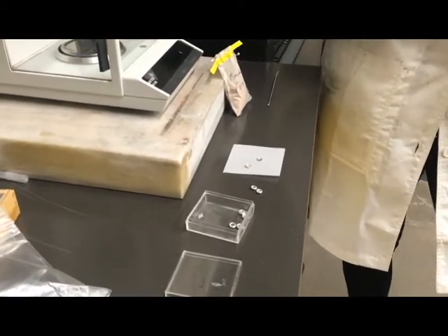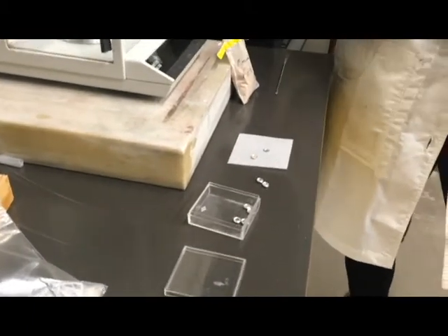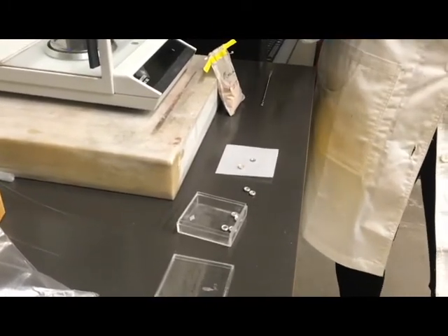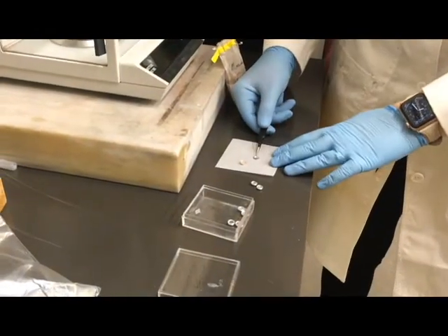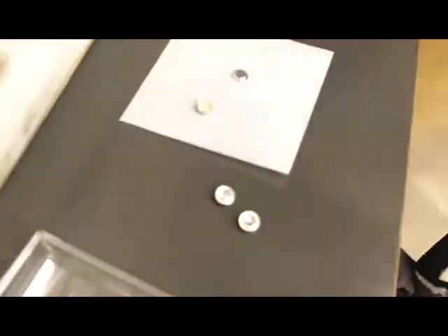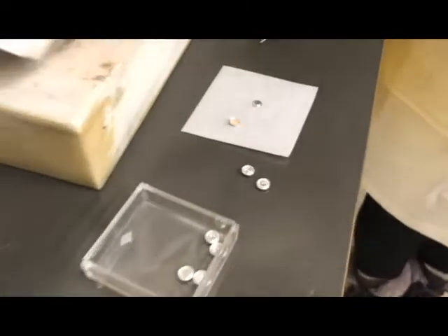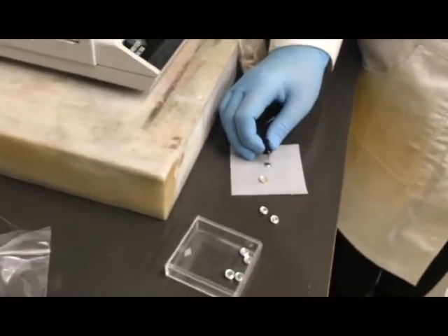It's entirely up to you. Some people don't poke a hole at all because they're not expecting any evaporation. If you choose to poke a hole in the lid, you want to make sure that every sample is the exact same as the reference. So if you choose a reference with the hole poked in the middle, you want to make sure our hole in our crucible is also poked right in the middle. Back in the wooden container we've got some pushpins — and you would poke the lid facing straight down.